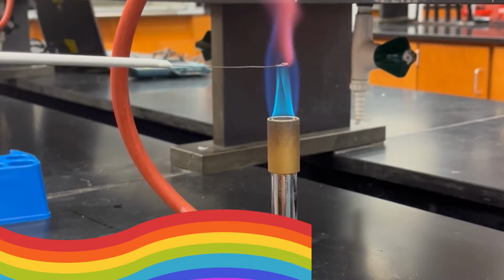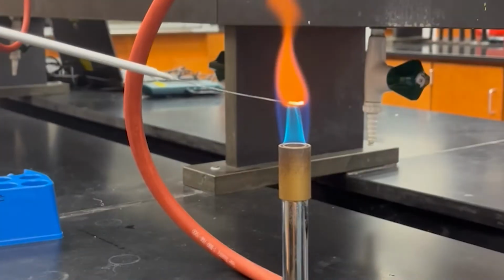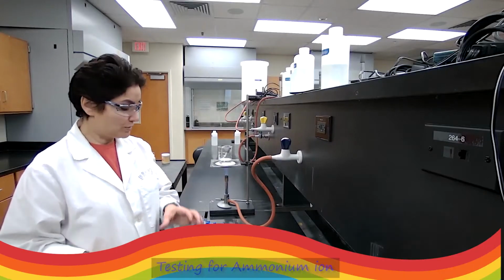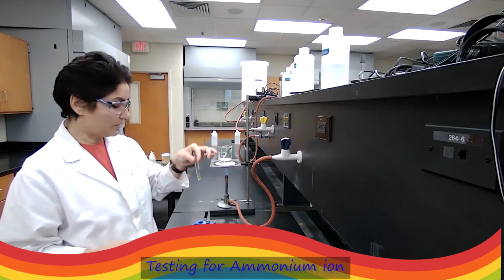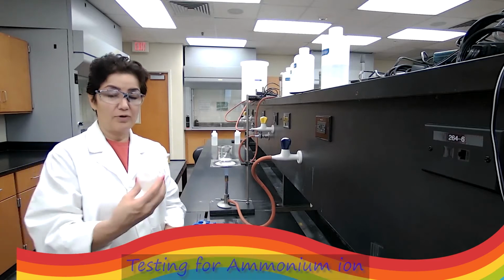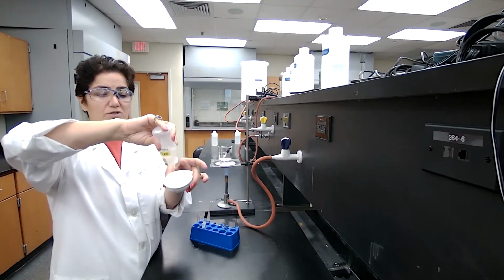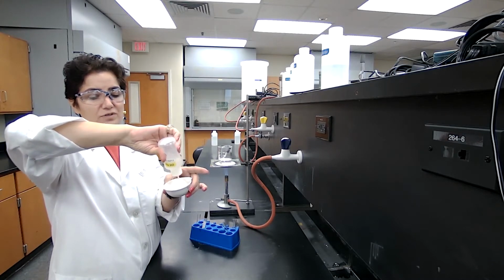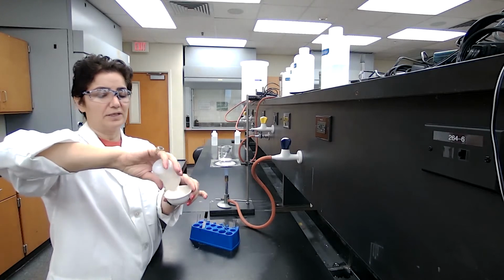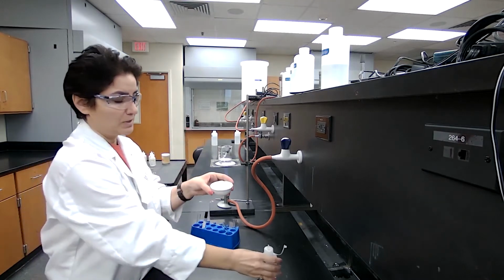Okay, we are using the unknown and we are checking for the presence or absence of the ammonium ion. Because it's an unknown, I'm going to follow the procedure. Place the 20 drops of sodium hydroxide into an evaporating dish. After I have the sodium hydroxide in the evaporating dish, then I will add the sample. Has to be the original.